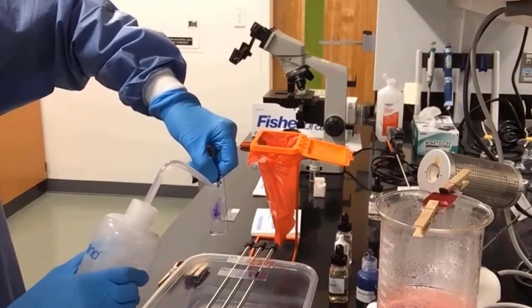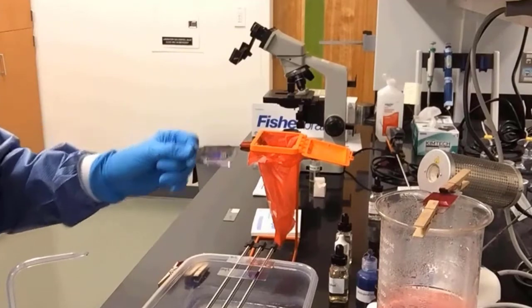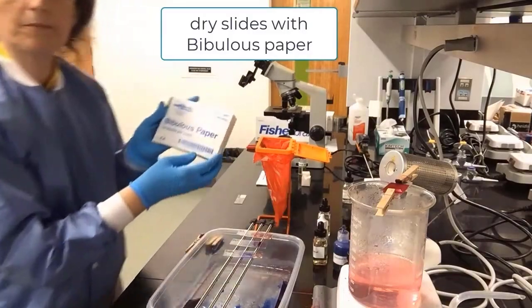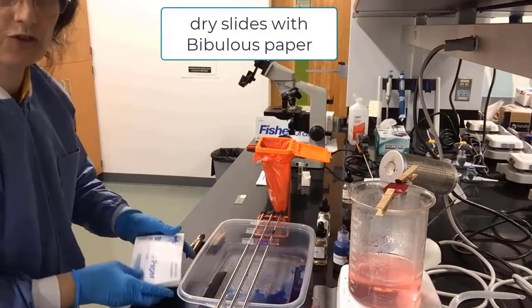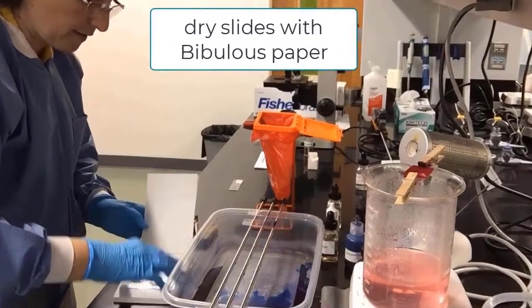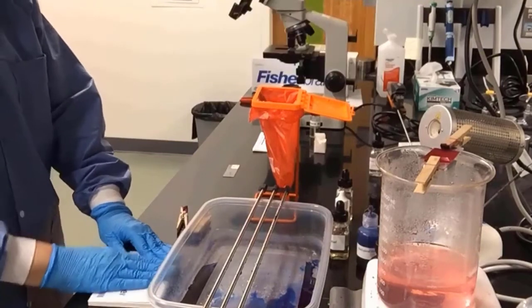And now we have completed washing all 3 slides. The next step would be to dry these slides. We pick up our bibulous paper. It's like a little booklet. We find 2 pages so we can put our slides in between in order to dry them. Just like that. We close our little booklet and we pat dry.